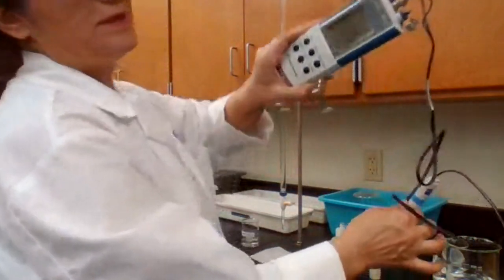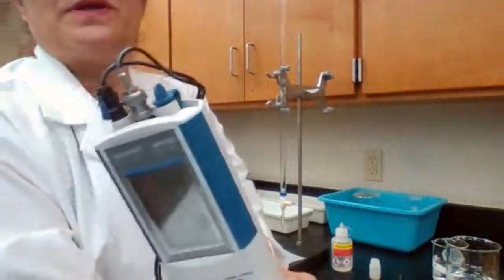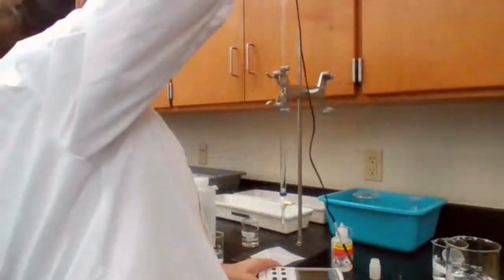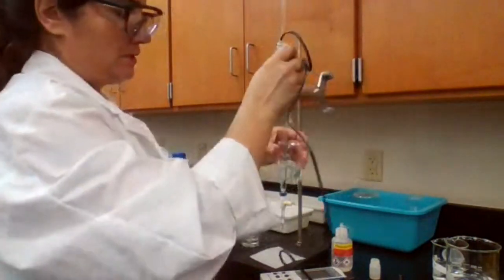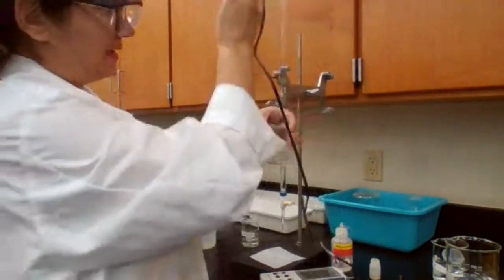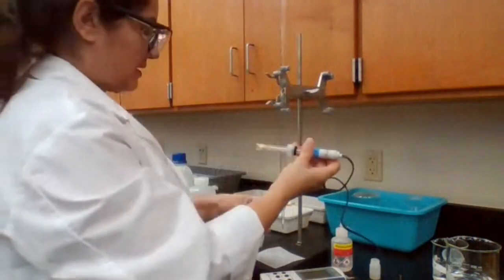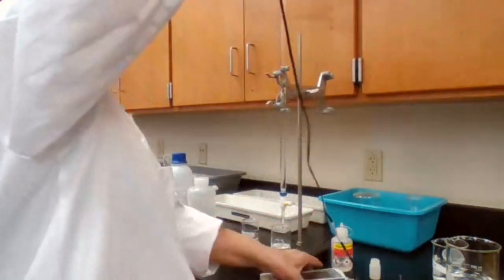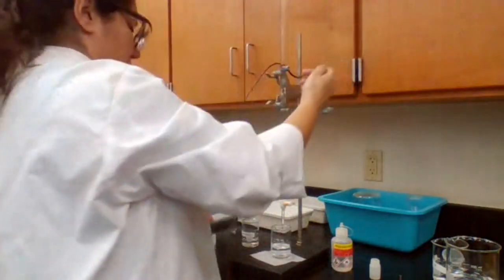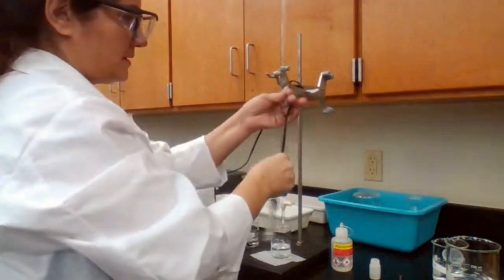So now it reads the pH as 7.01. That means that if I put another solution in, it is going to read the pH more accurately. Okay. I'm supposed to place the pH meter into the acetic acid, add the base, and record the pH. Because it's heavy, it might tip the beaker over, so I'm going to utilize this burette stand and put the weight on the burette stand so it doesn't.